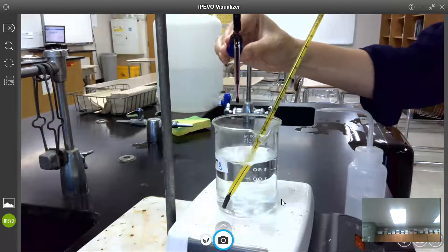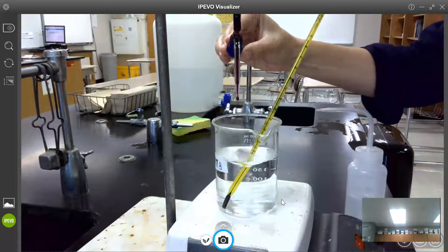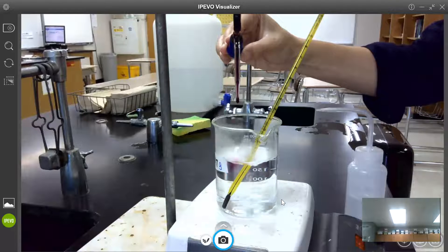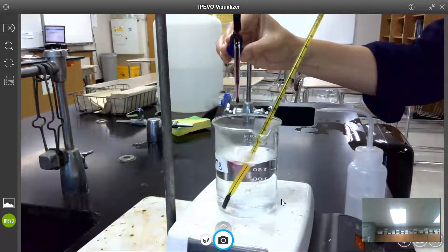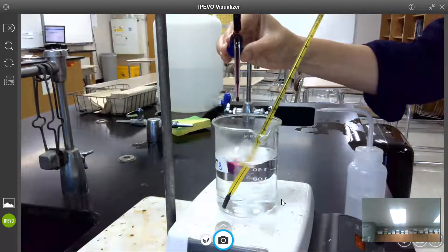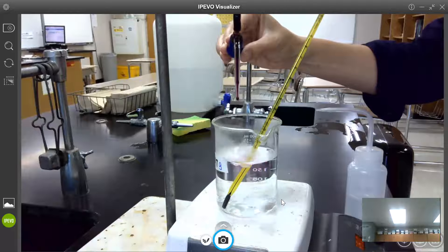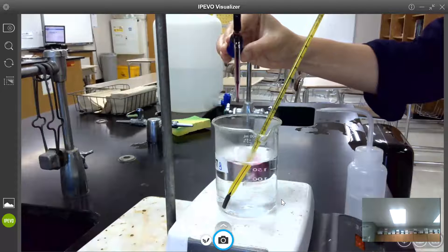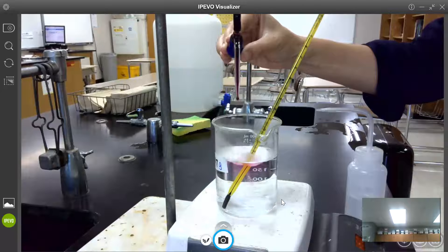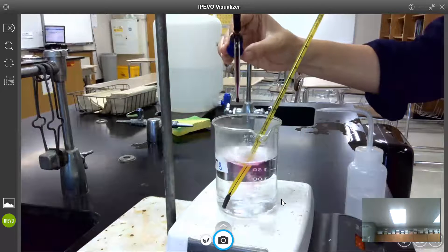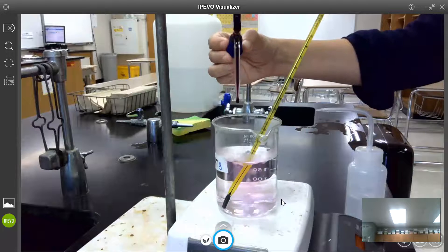I'm going to add a little bit more drop wise at this point. I'm at 44 milliliters still adding drop wise. I'm going to stop it right now.